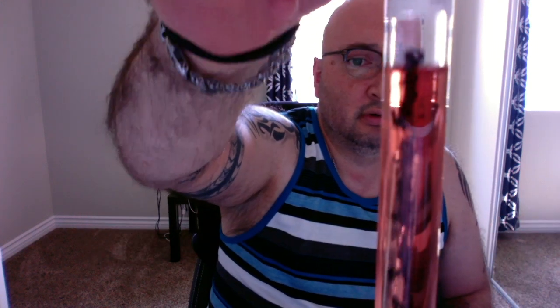Alright, so the next up is the S. epidermidis fructose. And there we go, S. epidermidis fructose. There's my Durham tube. So you can see some little bubbles in there. But the tube itself is at the bottom. The color of the phenol red has not changed from its original state. So, just like the previous S. epidermidis, this is a non-fermenter. Okay, so no fermentation took place.